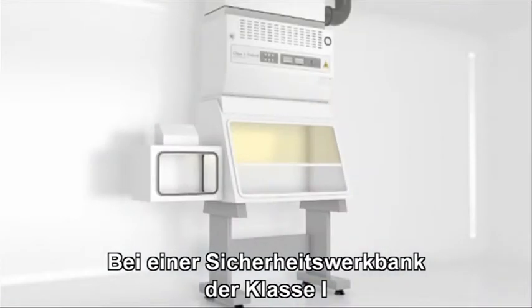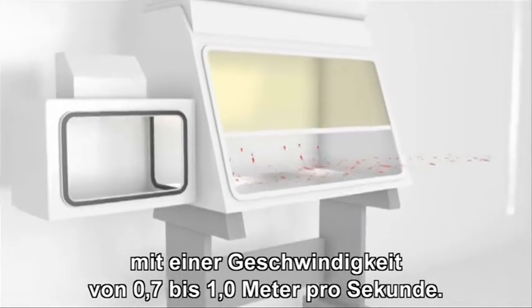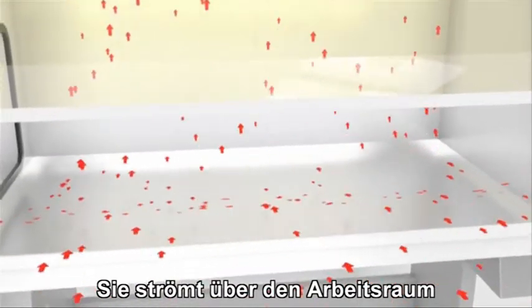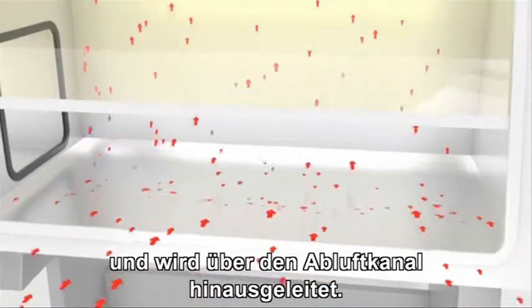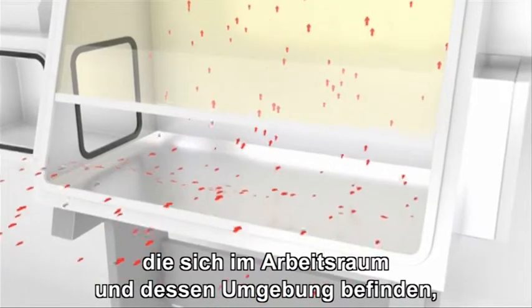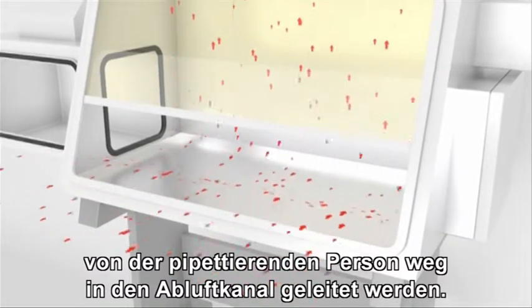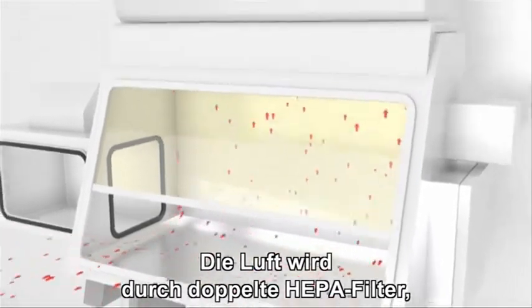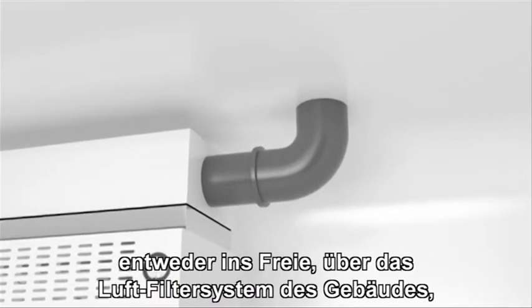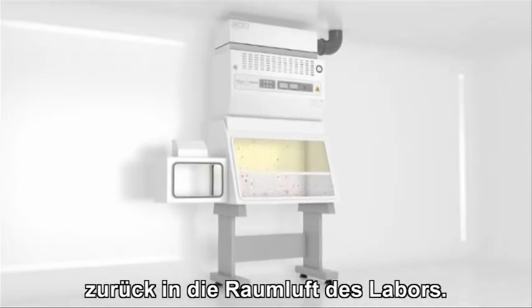In a Class 1 biological safety cabinet, room air is drawn in through the front opening at a velocity of between 0.7 meters per second and 1 meter per second. It passes over the work surface and is discharged from the cabinet through the exhaust duct. This directional flow of air ensures that any aerosol particles that may be present on or around the work surfaces are taken away from the operator and into the exhaust duct. The air from the cabinet is exhausted through double high-efficiency particulate air filters, HEPA filters, either to the outside of the building through the building exhaust system or, in the case of a recirculating type, back into the laboratory airspace.